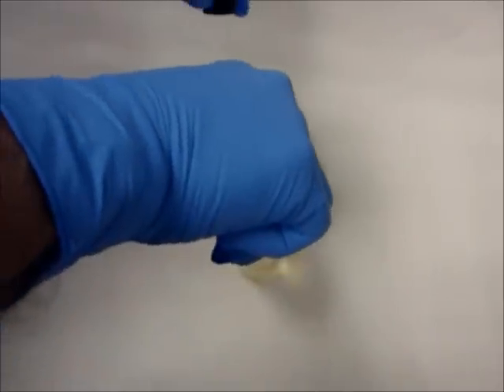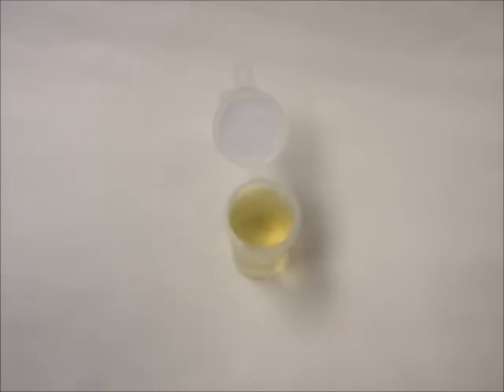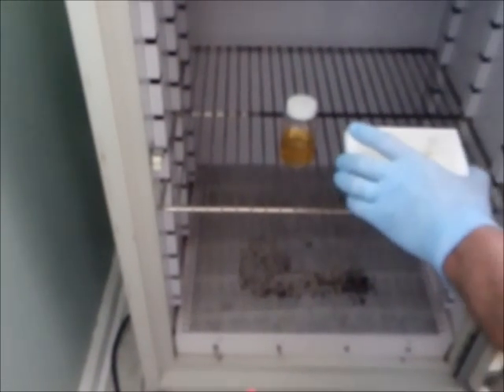Add 0.175ml of the specified media into a plastic mixing vial and add the remaining media to the 100ml sample. Incubate both the plastic mixing vial, which is your control, and the 100ml sample at the specified temperature for 5 hours.